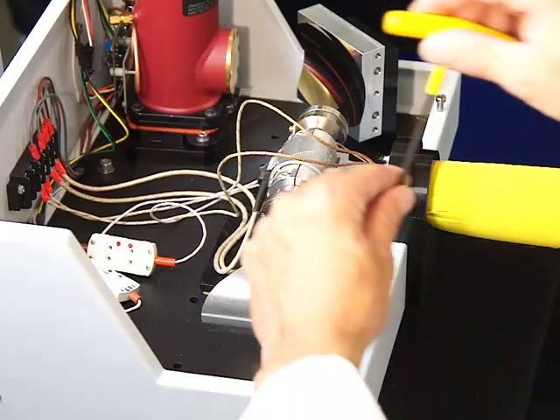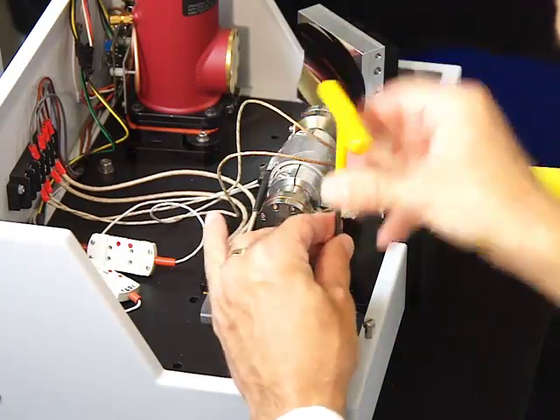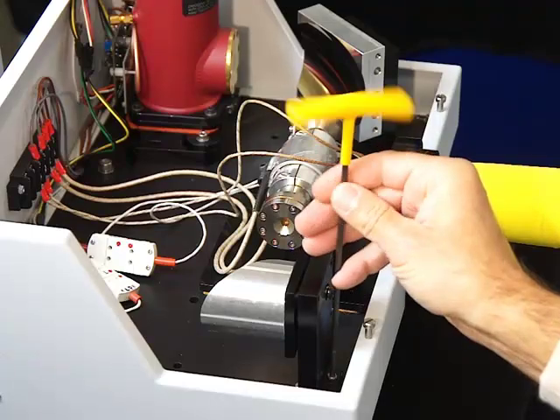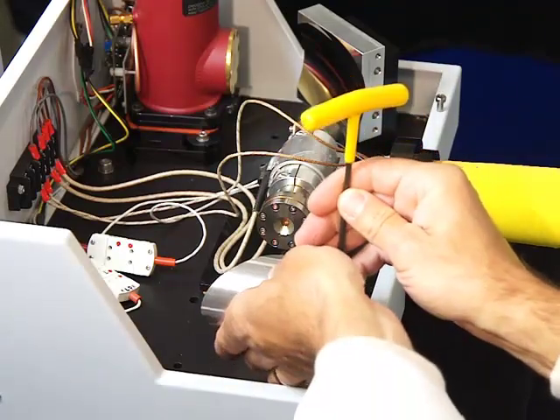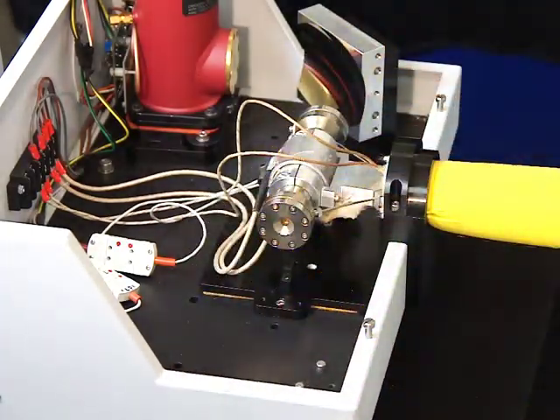Use a 9/64 allen wrench and remove the mounting screw. Lift the mirror up and place it carefully on a clean, flat surface. Do not touch the mirror.